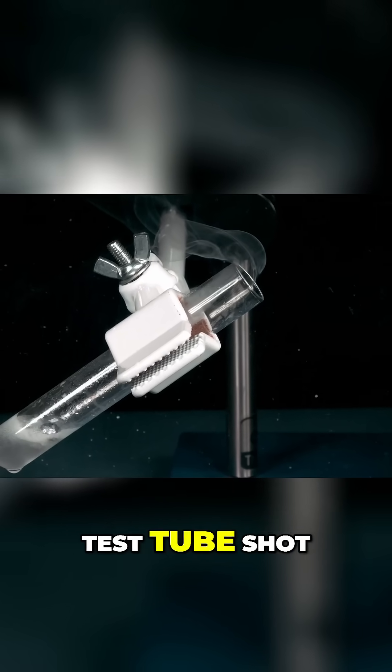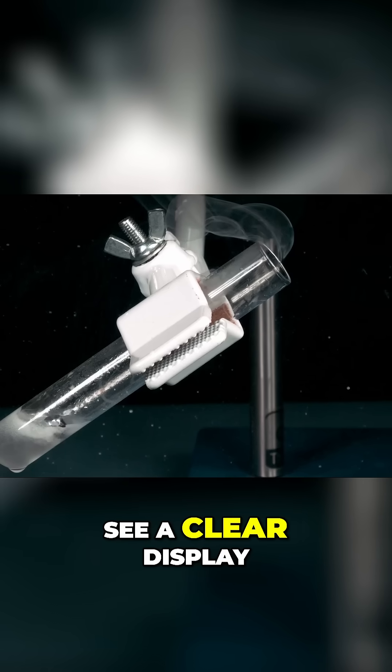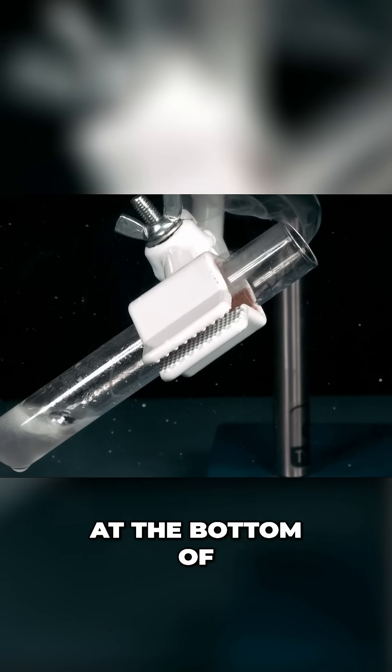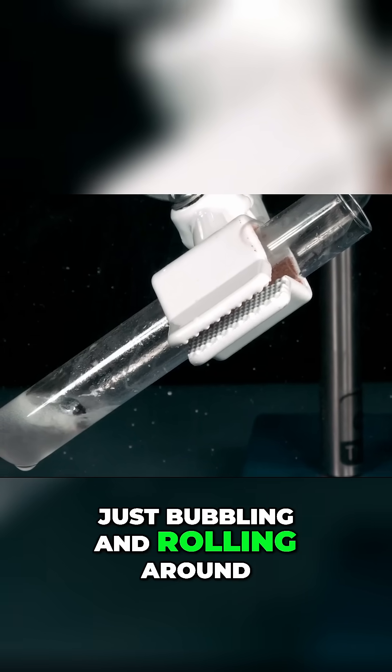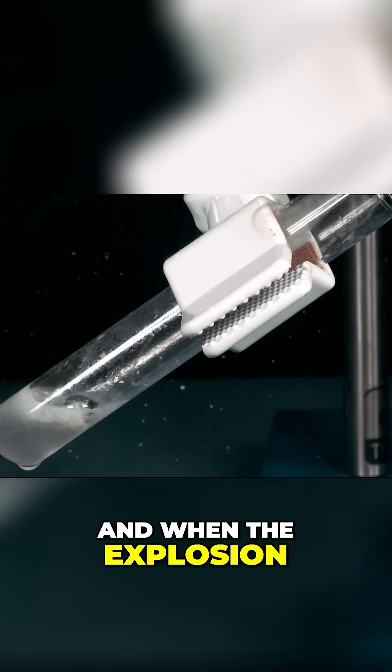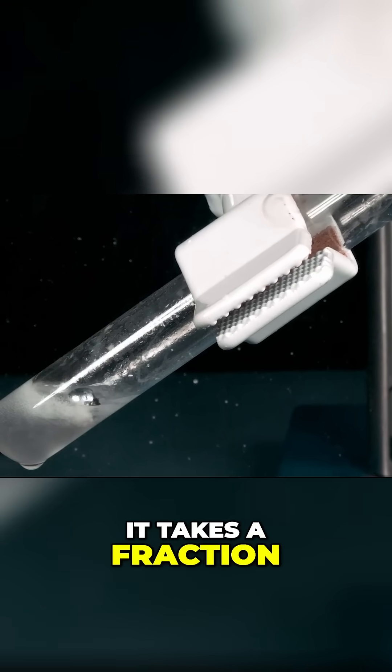So here's my last test tube shot and you can really see a clear display of the chaos there at the bottom of the test tube with the sodium that's molten just bubbling and rolling around. And when the explosion actually happens it takes a fraction of a second.